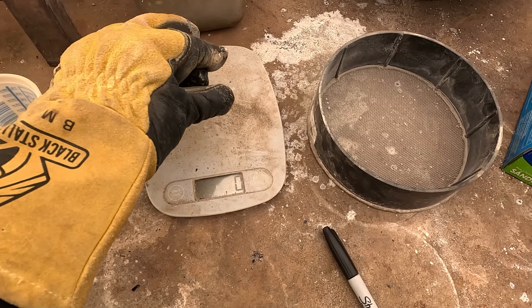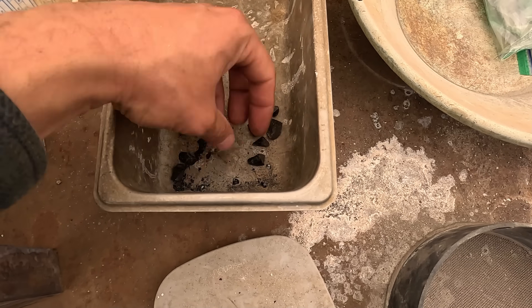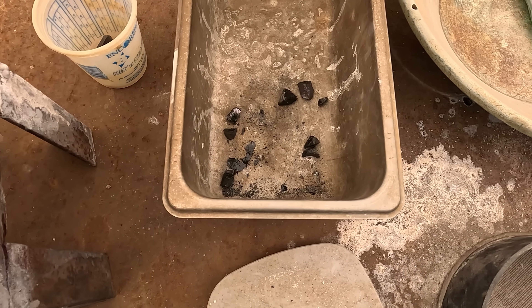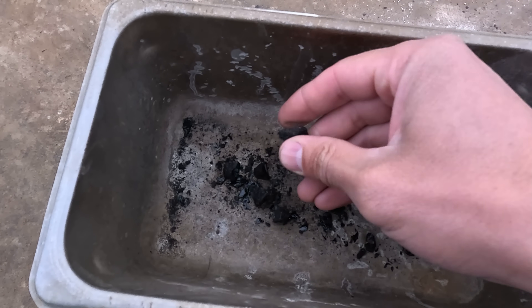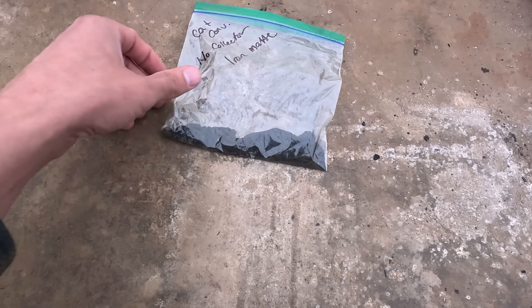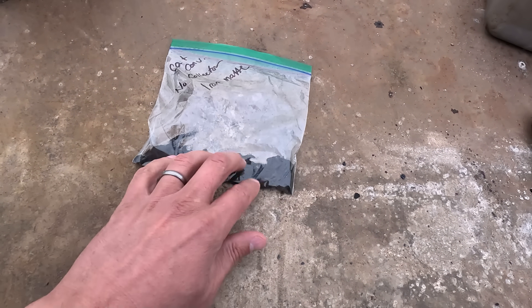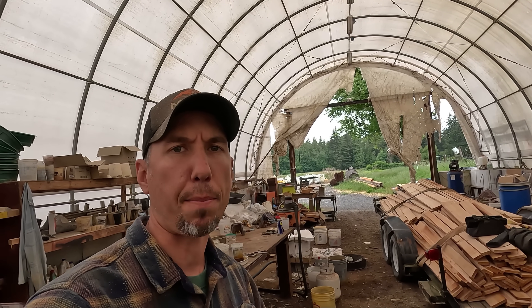We got our nice glassy slag, so we're doing something right there, but our matte did not cooperate on that smelt. We started with 40 grams and got 30–31, so we reduced it a little bit but not enough. I've broken it up into a couple pieces to increase the surface area and I'm going to leave it overnight to see if it reacts with water in the air and falls apart into powder. Well, it's still pretty hard after a couple days. There are a couple things that could have happened: I put the whole piece of copper-iron matte in the top of the smelt instead of powdering it for more surface area, or maybe I didn't add enough soda ash, or didn't give it enough time with the iron nails. There are too many things that can go wrong.